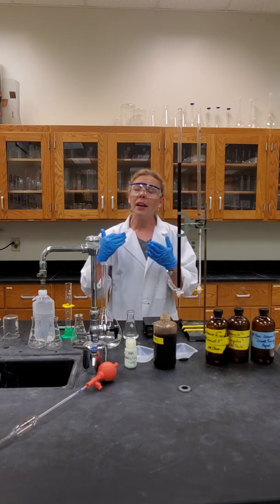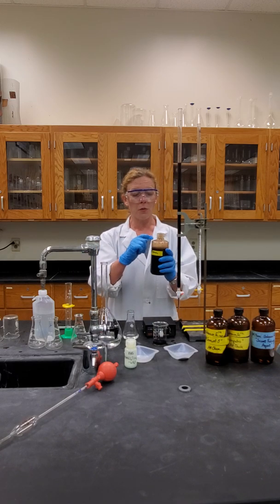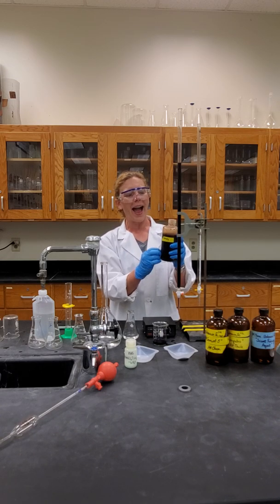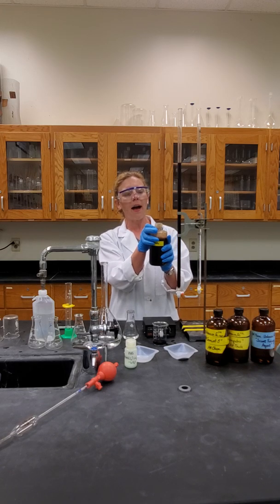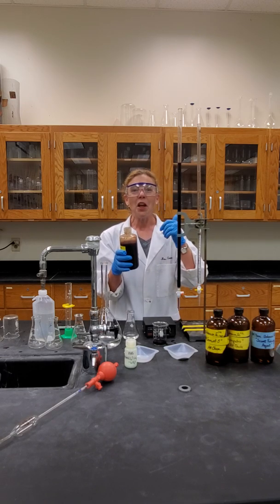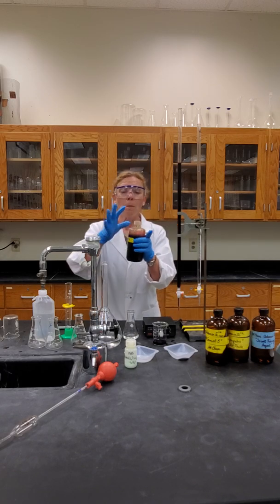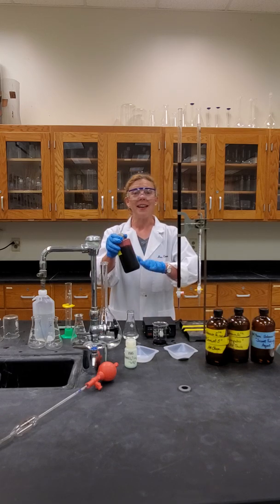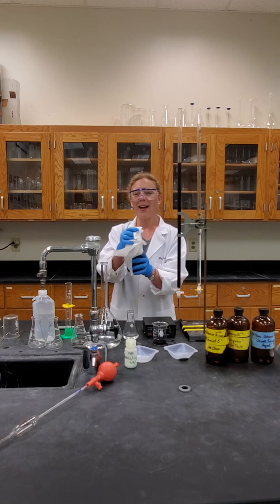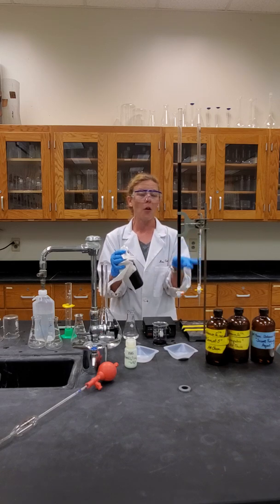You're going to follow your instructions and first follow the mass given, and we are going to make ourselves a potassium permanganate solution. You are simply adding the solid to the bottle and then adding water up to where the bottle begins to narrow — that will be about 500 milliliters. We're going to standardize this, so it's okay if we're a little greater or lesser in solvent addition. Be careful to agitate to help speed solution formation, but watch for any leaks. Use paper towel as a precaution, and overturn the bottle to make sure you've created a homogeneous solution.